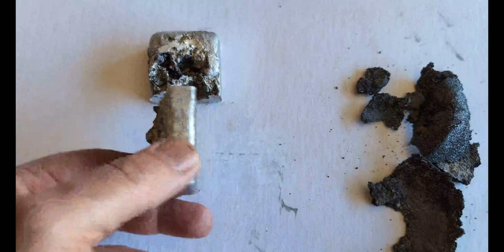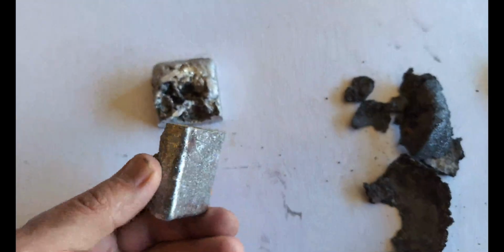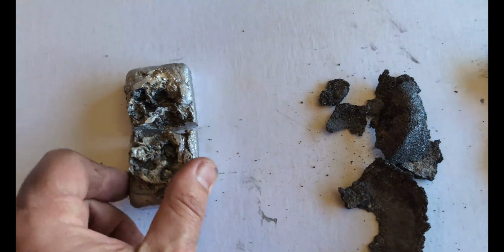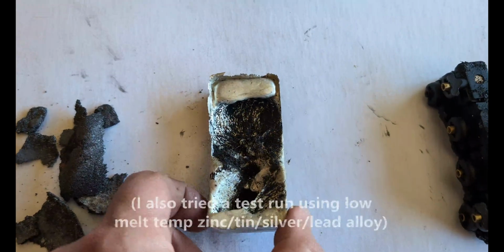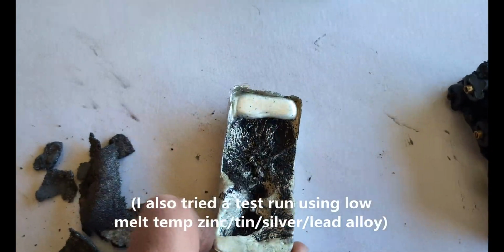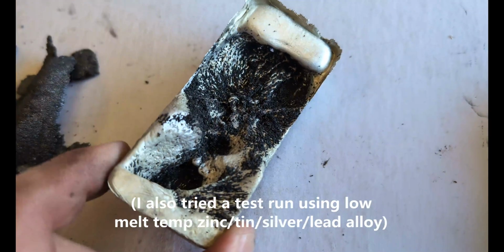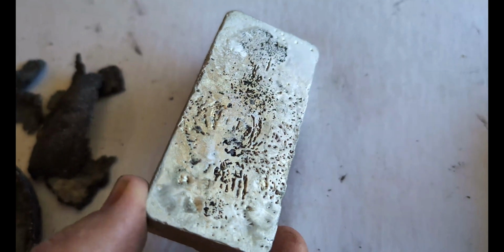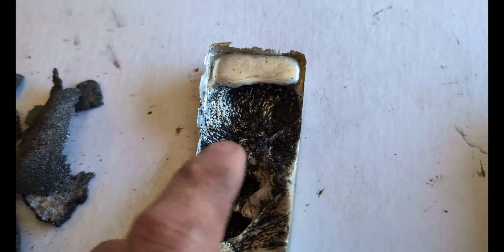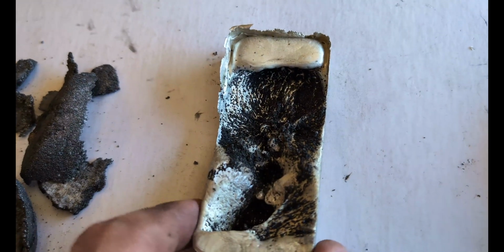Well, let's talk about the results of the experiment. The aluminum mix, I had some difficulty getting it to bond at all to the steel, and I had the same problem with the zinc metal mixture. Although this one, you can see it did pick up a bit of the magnetic field there, and that's pretty cool. That's kind of what I was going for, but trying to mix the powdered metal with the liquid metal was like trying to mix oil with water.